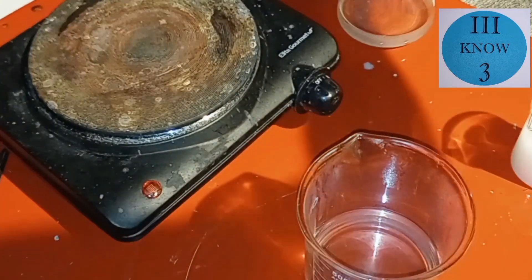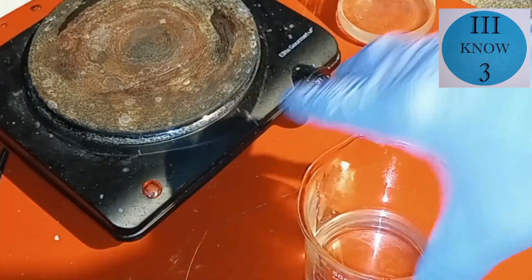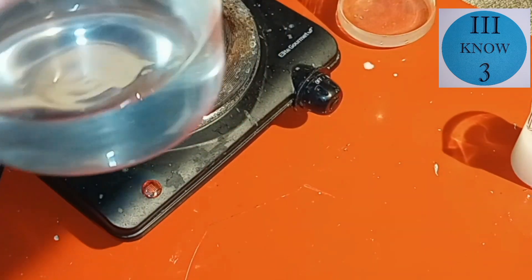Antimony and copper also don't dissolve in hydrochloric acid. And now you can see we have a very clear filtrate that hopefully is pure stannous chloride.